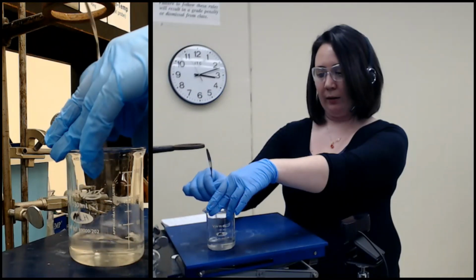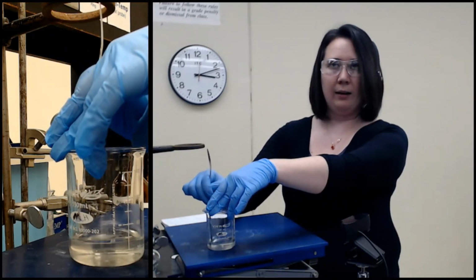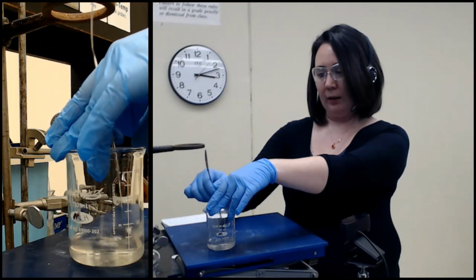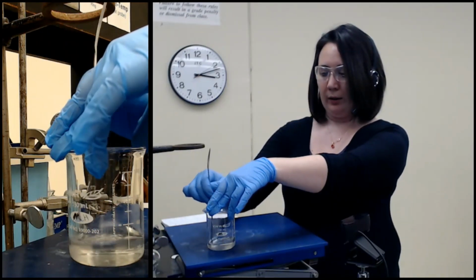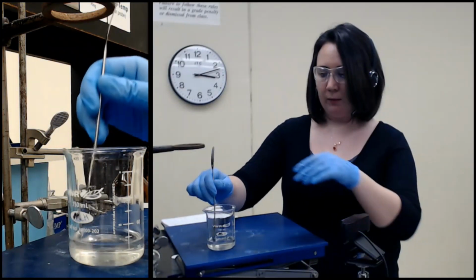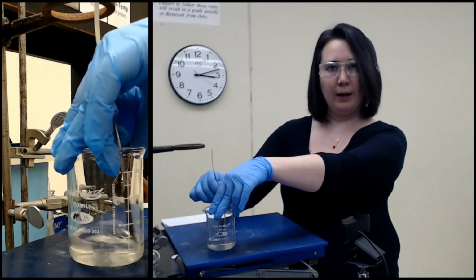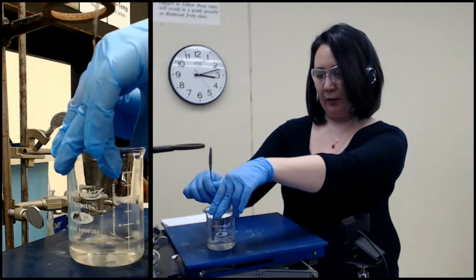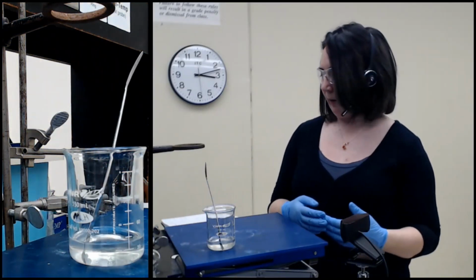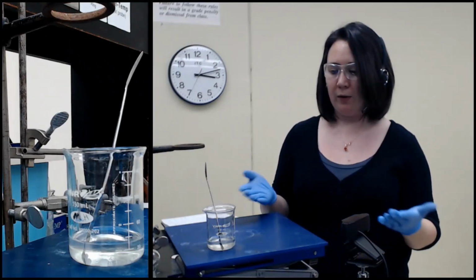And to decide that I am done stirring, that is, to decide that all the solid that is going to dissolve has dissolved, I'm looking for any solid left to be uniform. So here it looks like a clearer granular type solid. The other options were sort of a brownish powder or a white finer powder. So I want to make sure that it looks like everything is the same. And now that that's done, what I want to do is a quick gravity filtration to collect just that solid, and then we're going to move on with the rest of it.